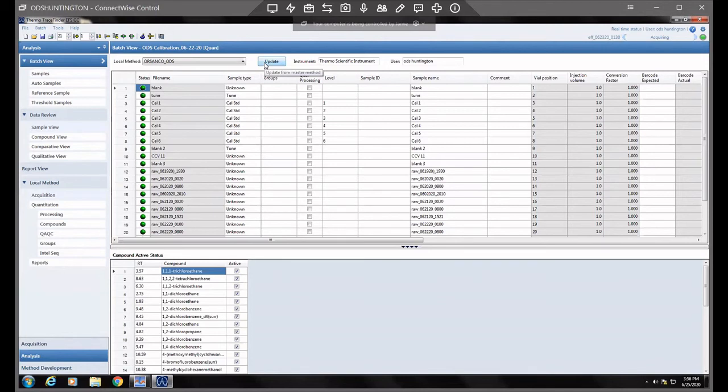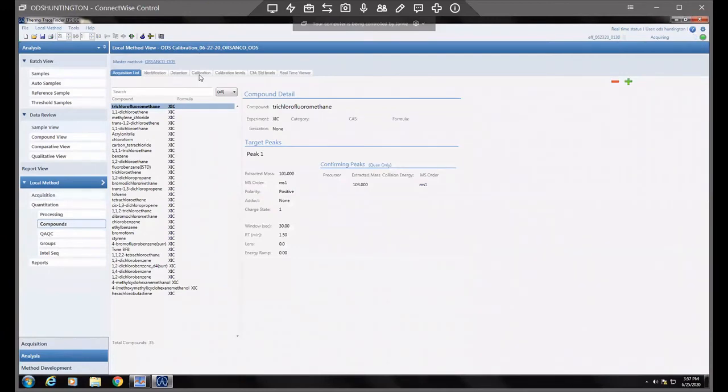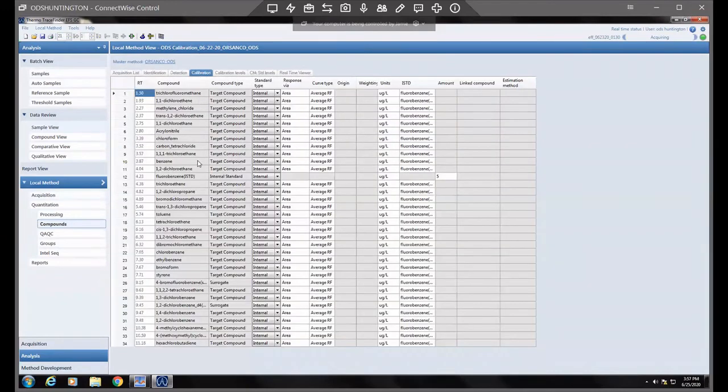So that's telling this specific batch that we're going to update it from that master method, and not the other way around. With TraceFinder, there are two methods: your local method and your master method. On your local method, you can change compounds and things specifically for this run only. But when I change it on the master method, any time you use this ORSANCO ODS method, they will all be updated to that.